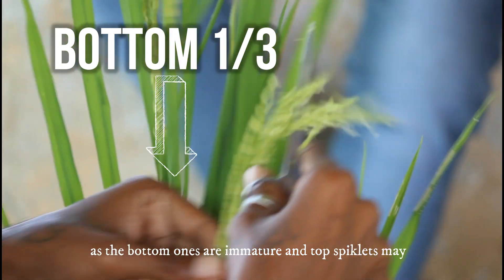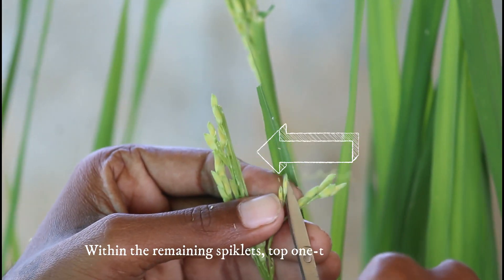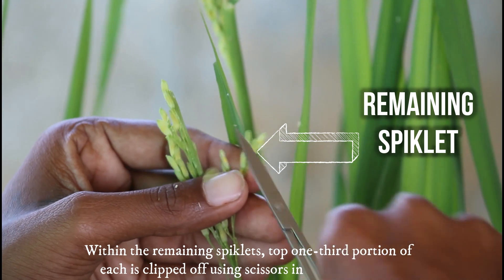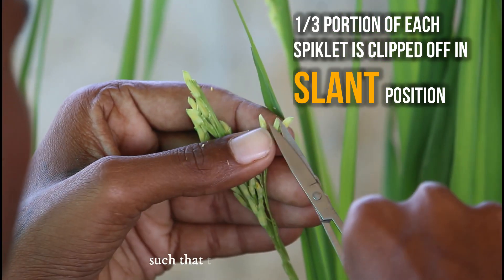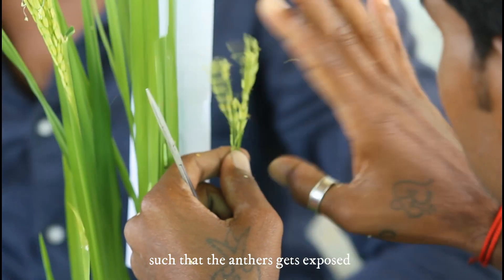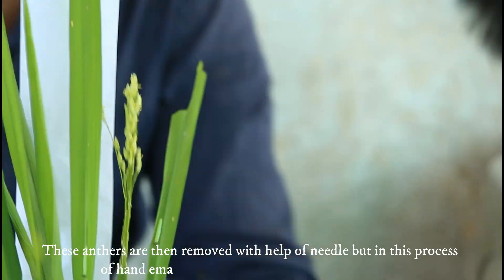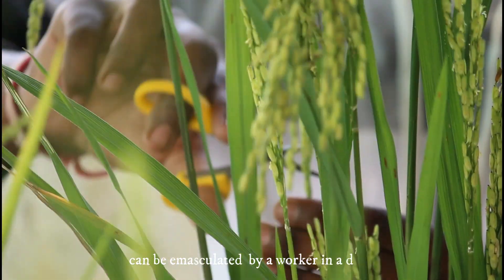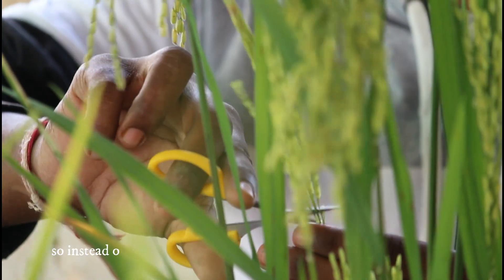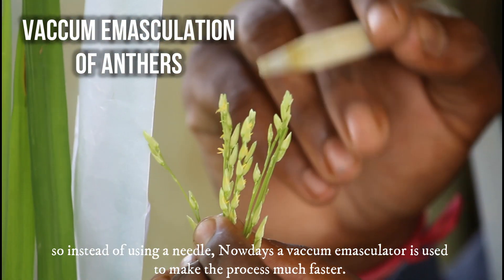Within the remaining spikelets, the top one-third portion of each is clipped off using scissors in a slant position such that the anthers get exposed. These anthers are then removed with the help of a needle. However, in this process of hand emasculation, only a small number of spikelets can be emasculated by a worker per day. So instead of using a needle, nowadays a vacuum emasculator is used to make the process much faster.